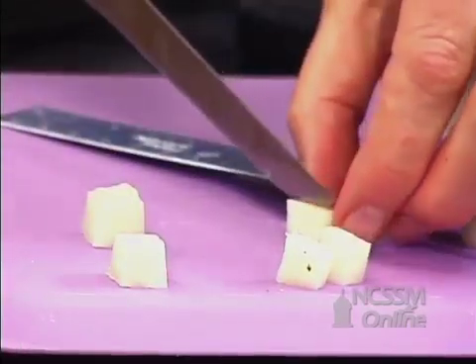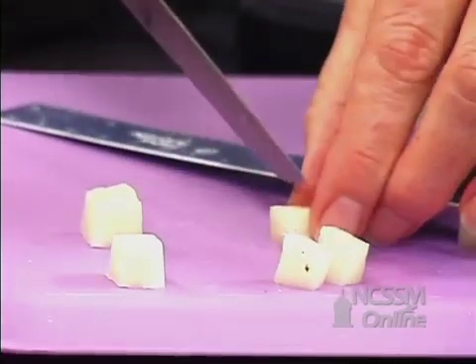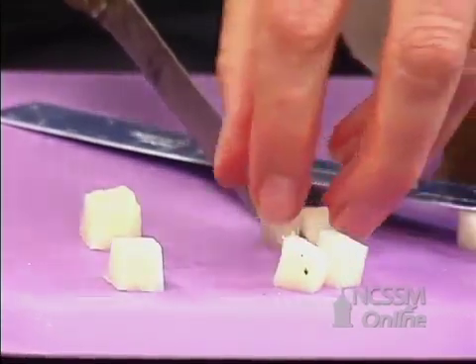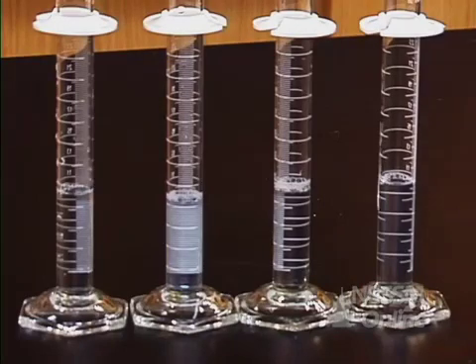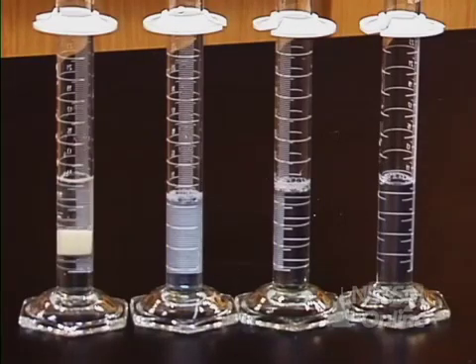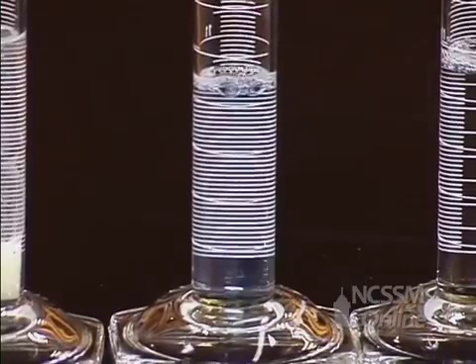And this one I'm going to cut in sixteenths. I'm going to drop one in each of our graduated cylinders, and we're going to time them.